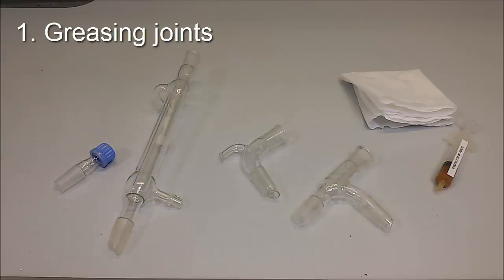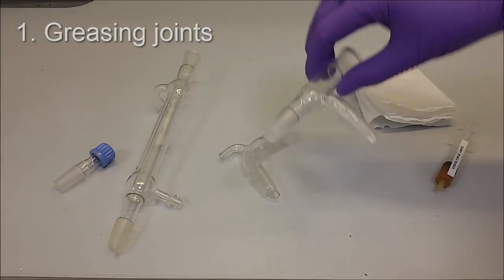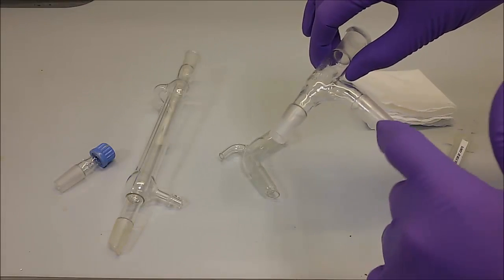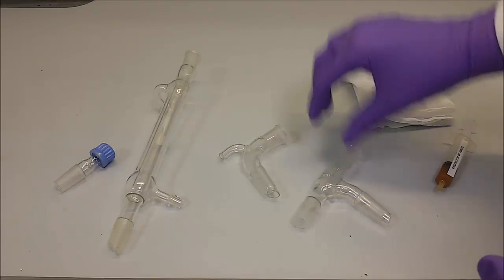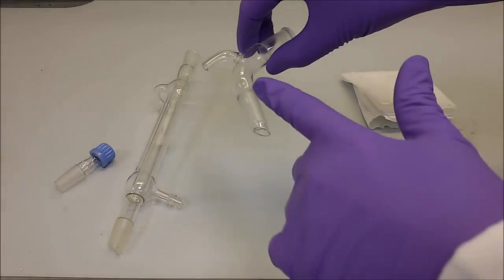Before setting up the apparatus, grease all the joints. This prevents the glassware from getting stuck together, as well as the vapors from escaping the setup. These are the joints to be greased.